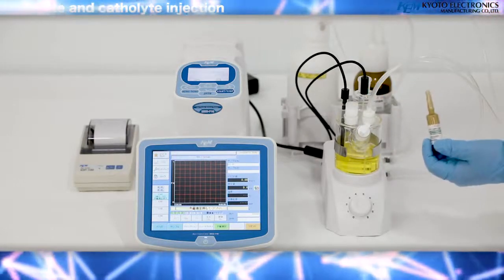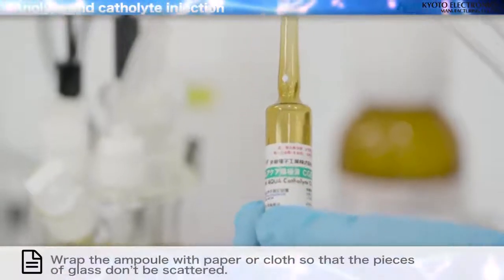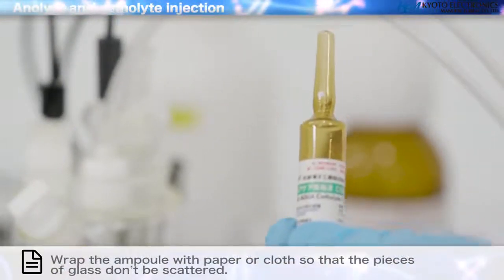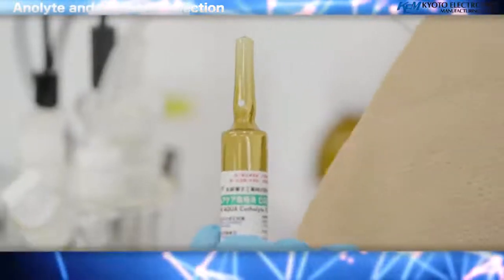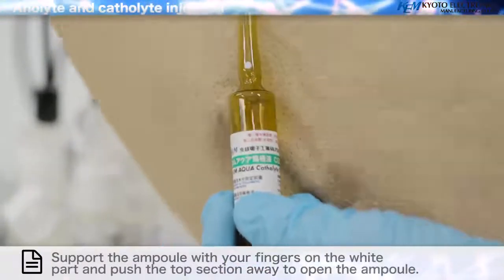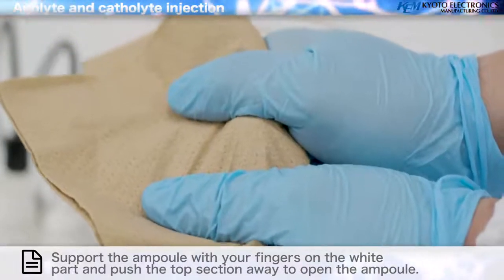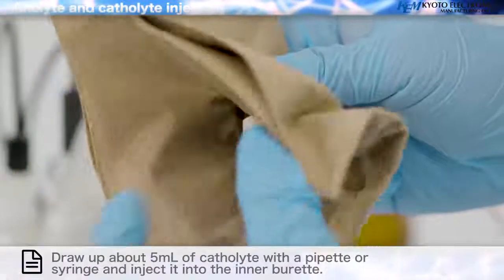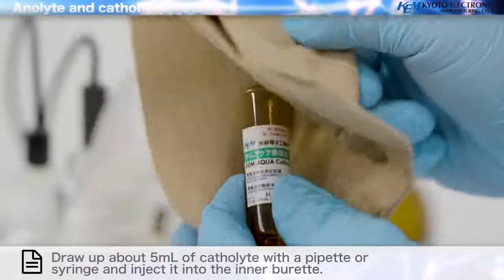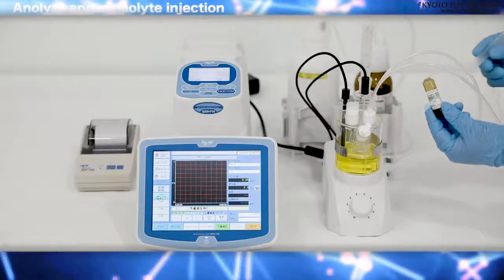Prepare a glass ampule containing catholyte. Wrap the ampule with paper or cloth so that the pieces of glass don't scatter. Support the ampule with your fingers on the white part and push the top section away to open the ampule. Draw up about 5 milliliters of catholyte with a pipette or syringe and inject it into the inner burette.